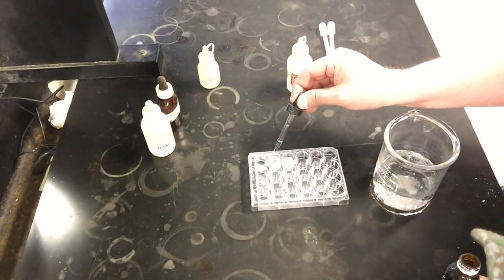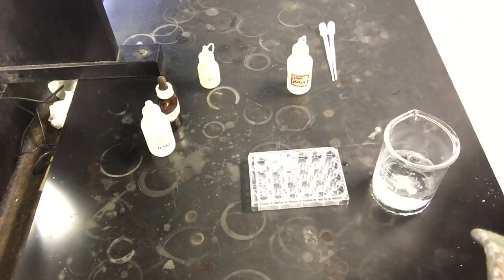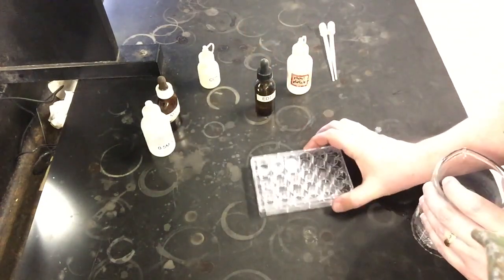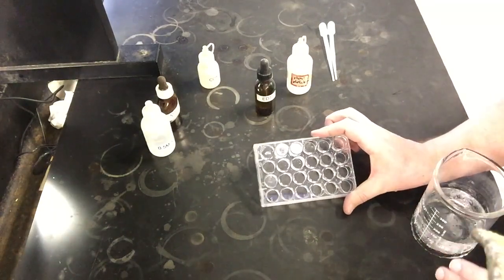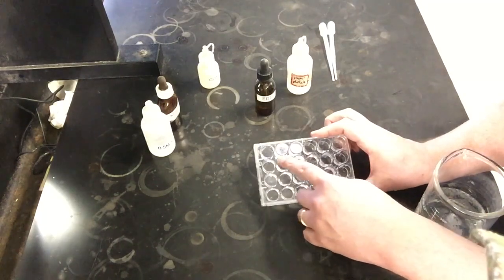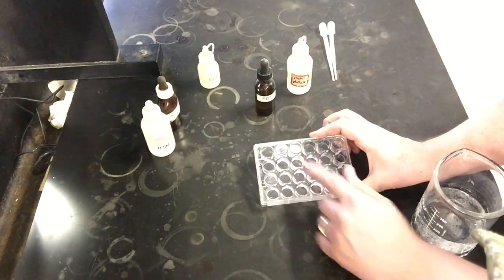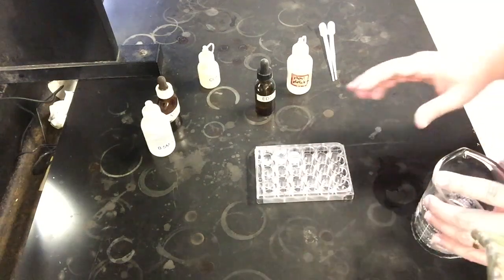And as I add it, it's not happening quite as quickly as it did with the hydrochloric acid, but I'm getting a very similar effect, especially as it sits there for just a little bit. Now if I mix up my solution and look at it from above, it's not all the way clear, but if I give this some time and probably add some more EDTA, it will eventually get to be clear, like with the one that I added the HCl to. It's nowhere near as cloudy and thickly white as the other solution that we started out with. So that's the big thing that I wanted to highlight there.